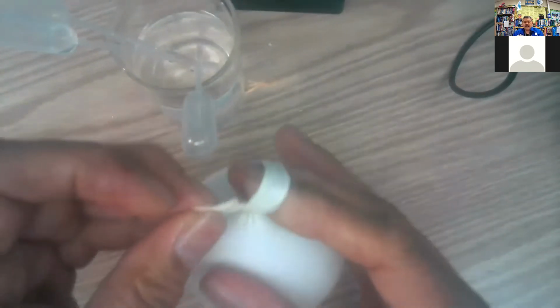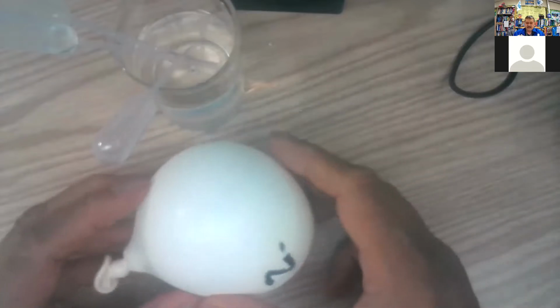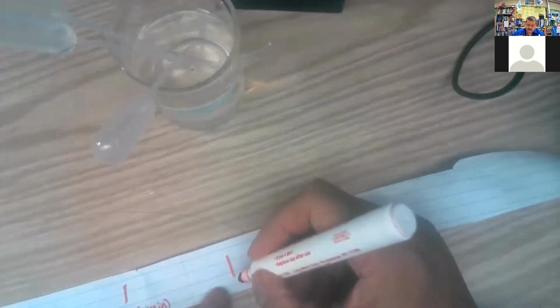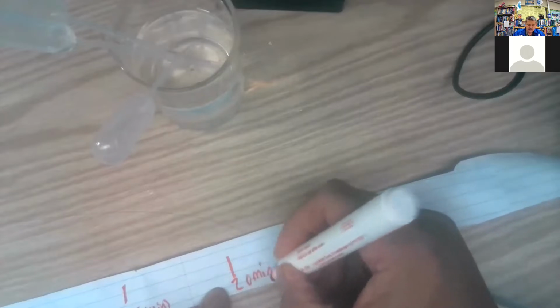2, 3, 4, and 5. Woo! Got it in there. There's number 2. You can see it going, so I'm going to try to get a quick measurement. There it is. Okay, there's my 2 measurement. What's 3 going to be like? There's 2 at 0 minutes.